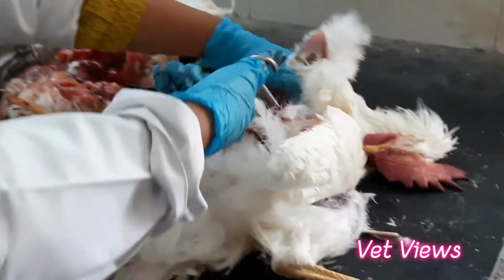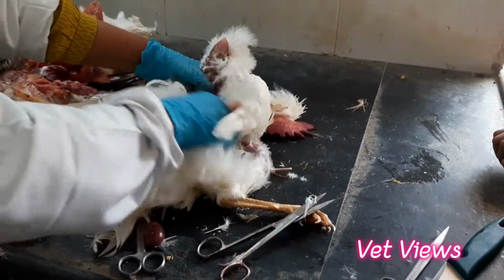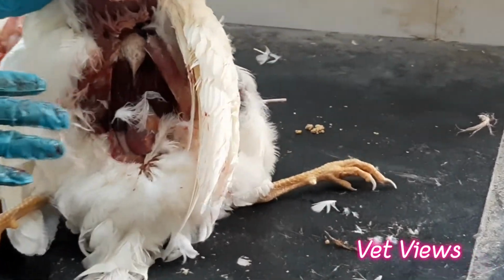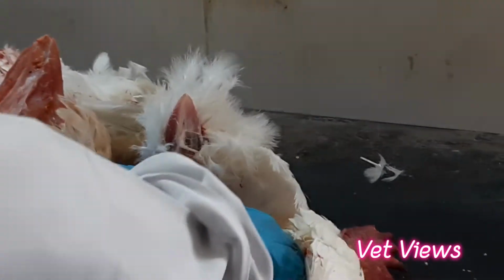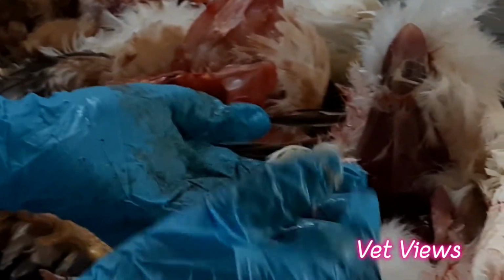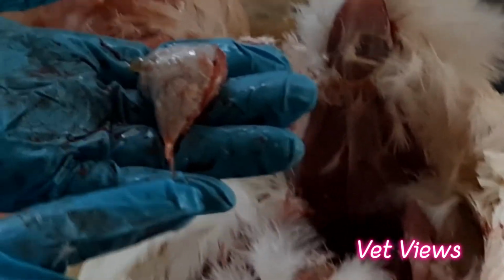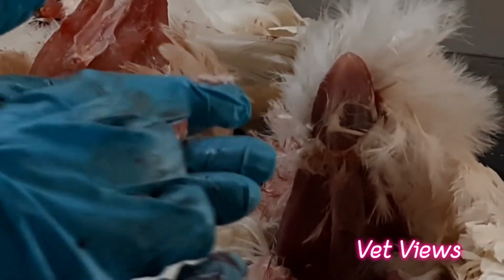And if you see this case, here the heart is completely blocked. There is a white colored membrane completely deposited over the heart. This is called urate deposition over the heart. The uric acid is there, no, because of the excretory metabolism. So the urate has been completely deposited over the heart, blocking all other functions and causing mortality. So this is called urate deposit.